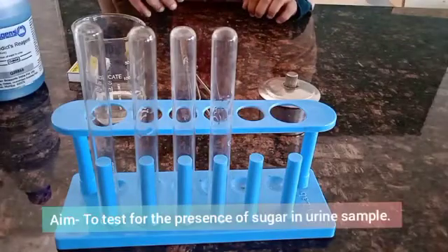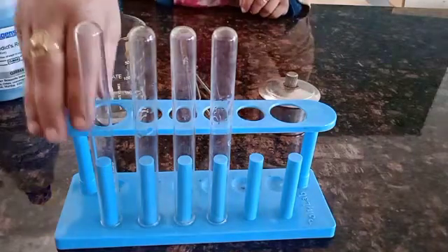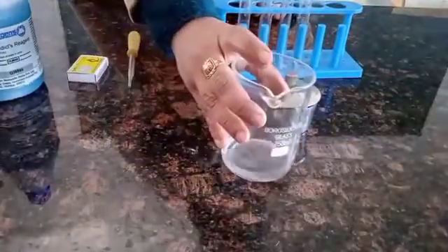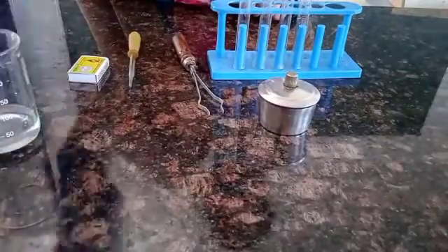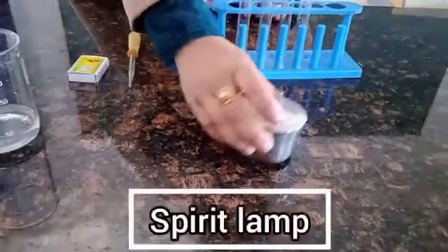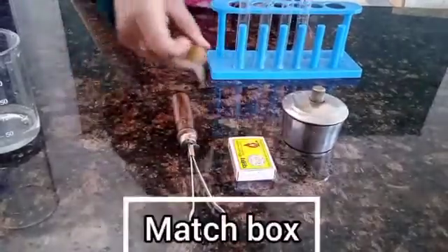Aim: to test for the presence of sugar in a urine sample. Materials required: test tube, test tube stand, urine sample, Benedict solution, spirit lamp, test tube holder, matchbox, and dropper.